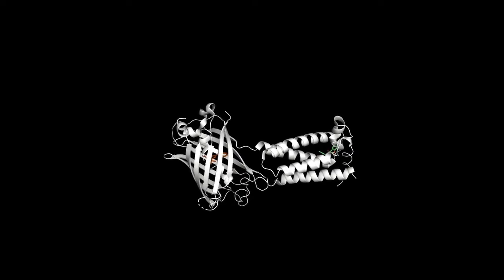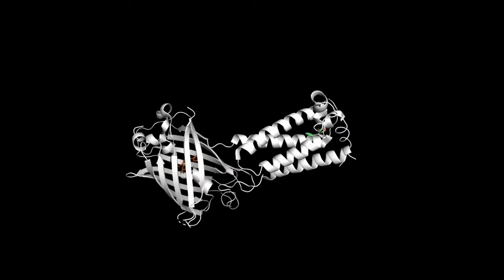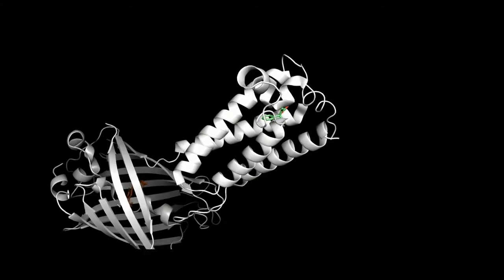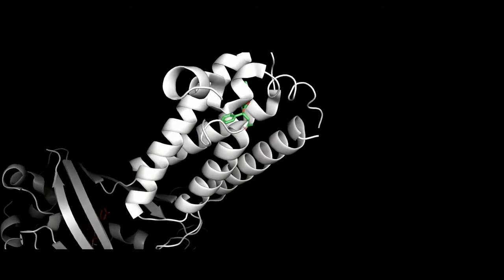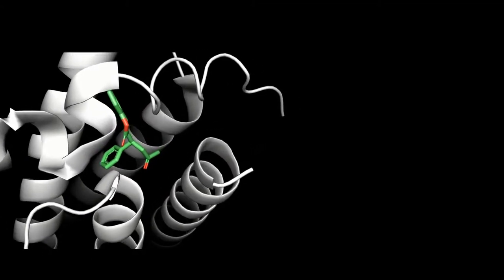In this movie, the VKOR enzyme shown is not identical to the VKOR enzyme found in the human body, due to the fact that the enzyme in this movie has two modifications. The first modification is an amino acid substitution at position 185, where a cysteine residue is substituted for a serine residue. This modification has not been characterized in the VKOR structure being observed in the movie. However, it can be interpreted to be present between the white tube present at the bottom left and the white tube present at the top central right.